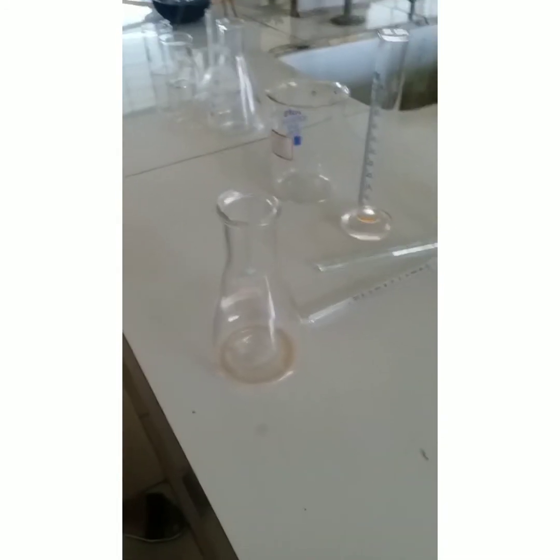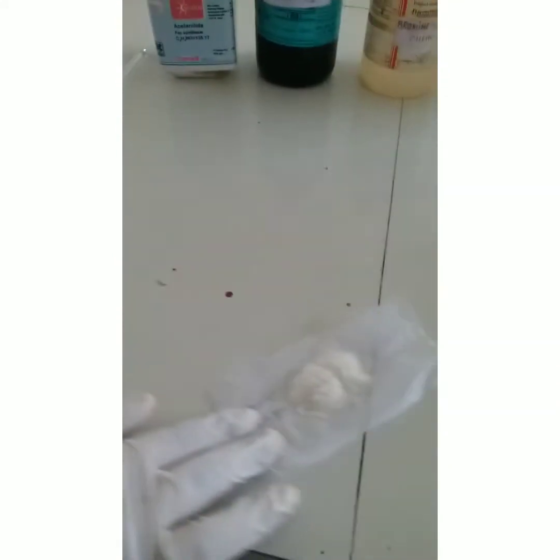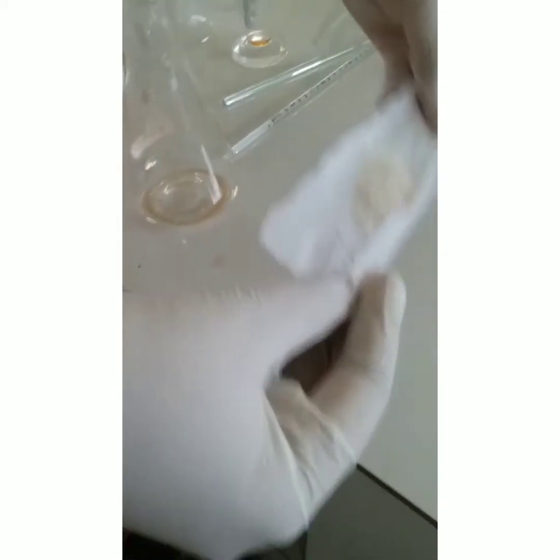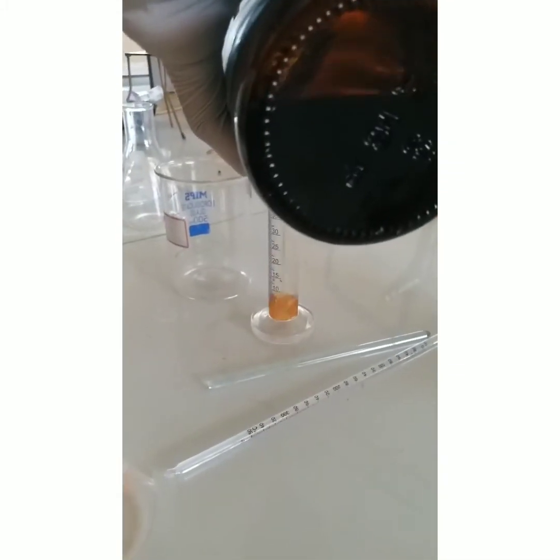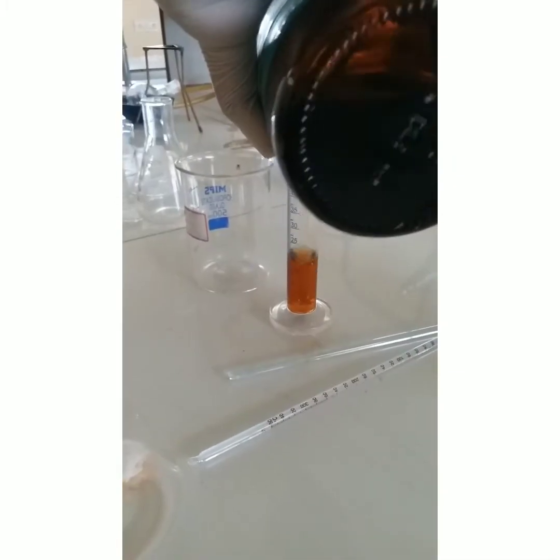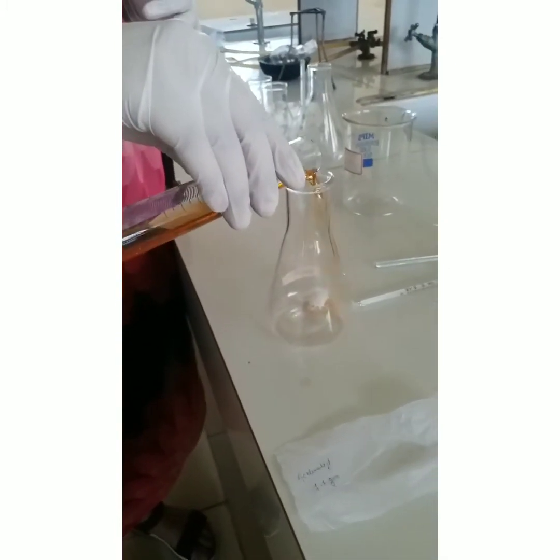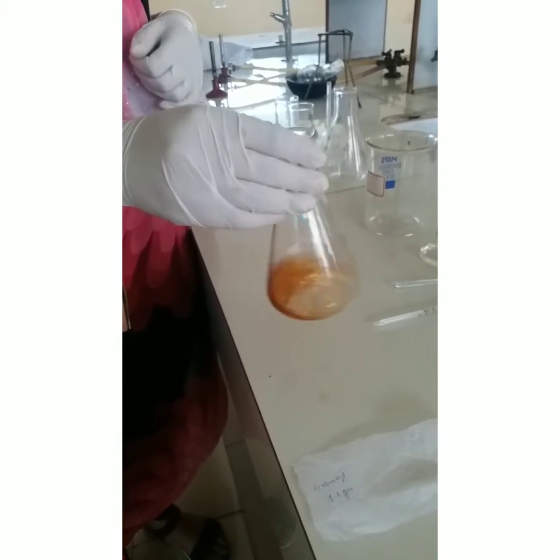First, take one conical flask and dissolve finely powdered acetanilide — 7.7 grams — in 23 ml of acetic acid. Shake well continuously.